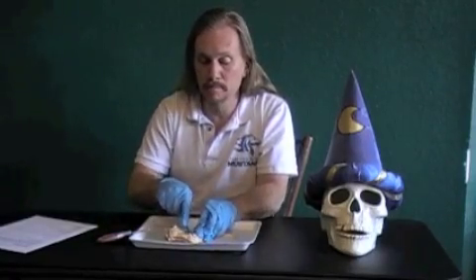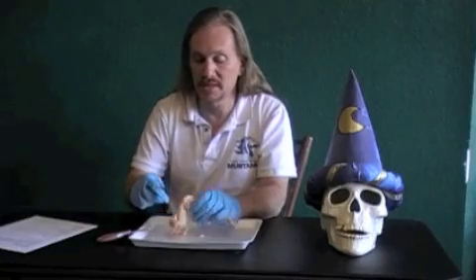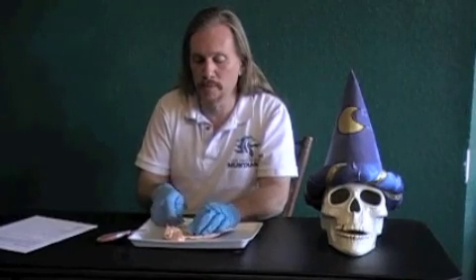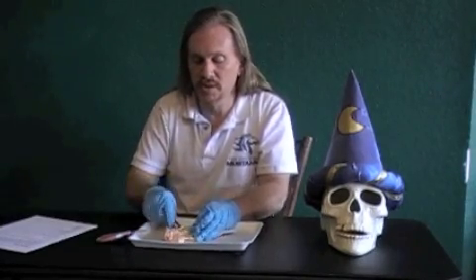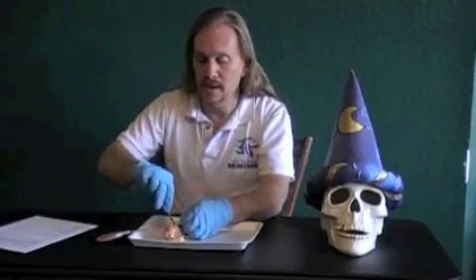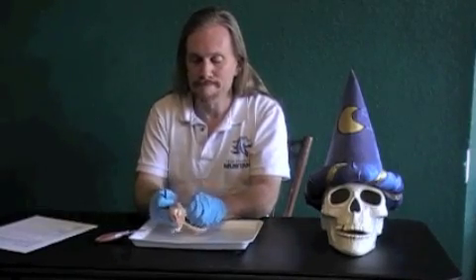Make sure that you wear your gloves while doing this because chicken carries a lot of different diseases, including botulism. So make sure that when you do this you do it very carefully. Do not eat or drink during this because you don't want to contaminate anything. And dispose of everything properly once you've finished.